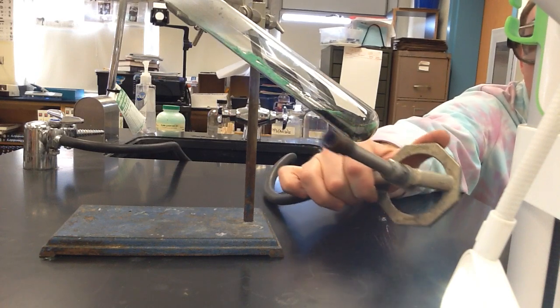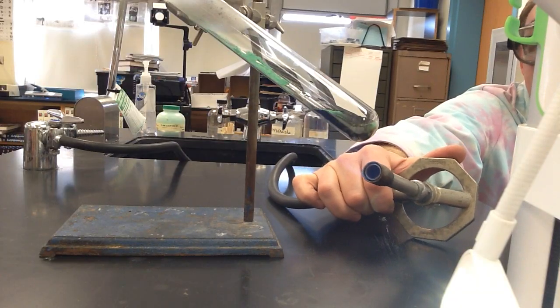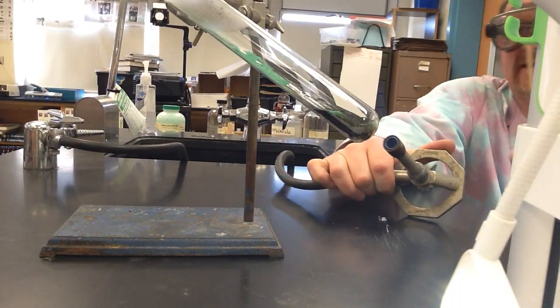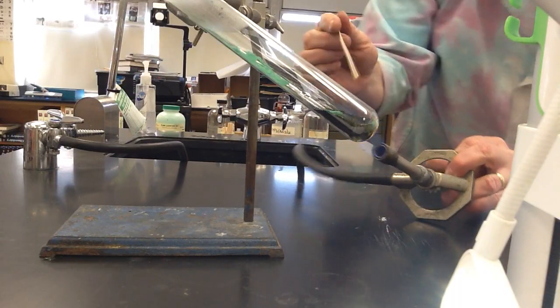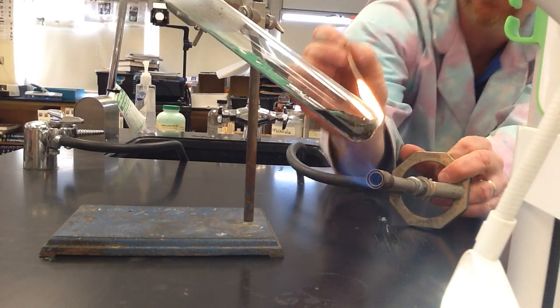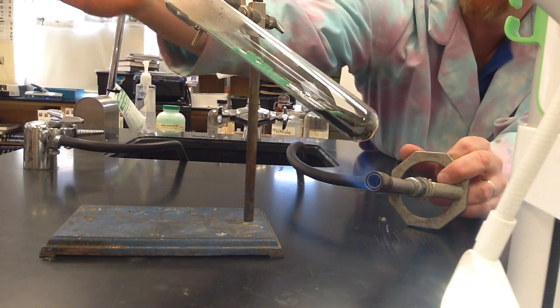So again, the only way we're going to know which reaction we have is by flame testing this gas. But you can see the gas kind of moving around. All right, so let's light this on fire and let's see what happens to the flame.